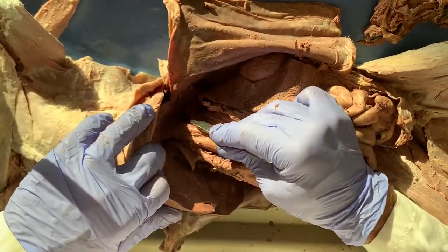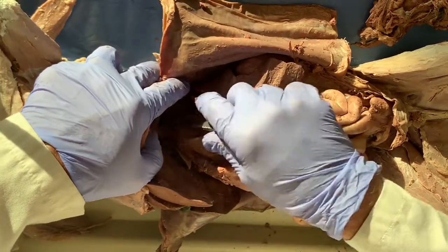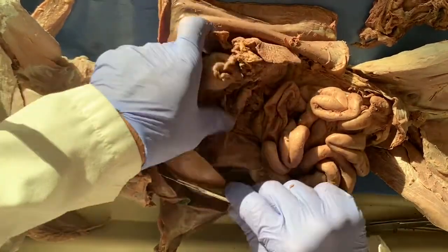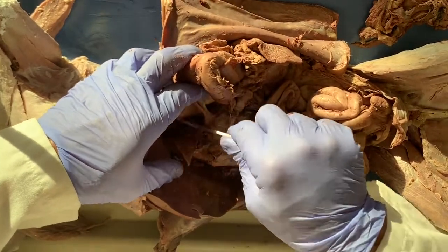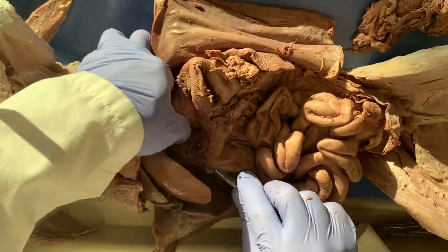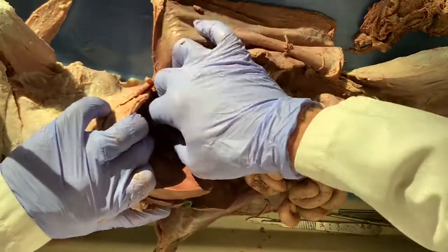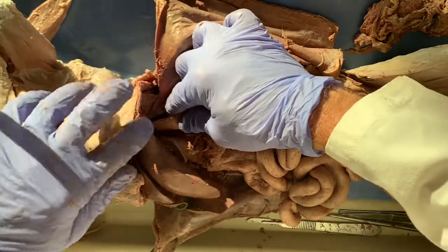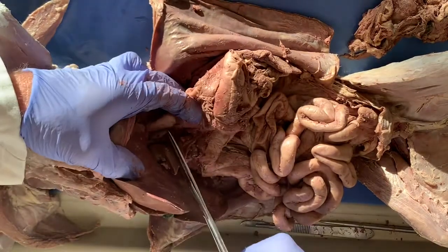So find the edge of the stomach. I'm going to make these incisions into the diaphragm wall, and break the connective tissue that's binding it until I can see the esophagus, which has a white tube appearance to it. And now I can see right here. Then I pull it down and snip the top of the esophagus.